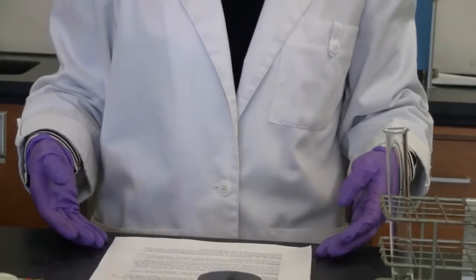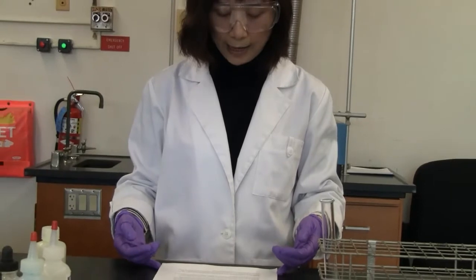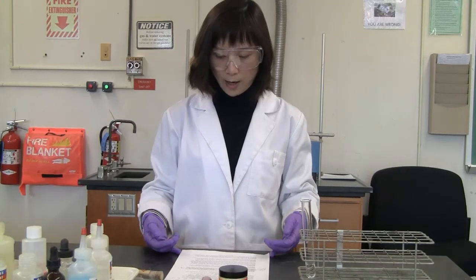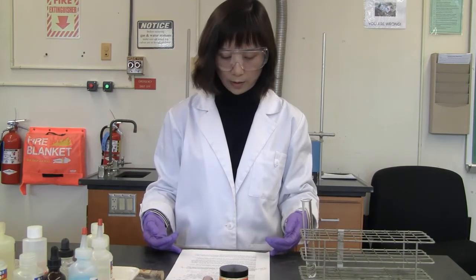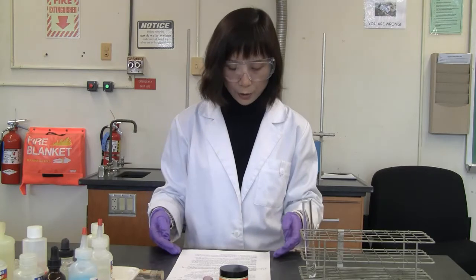For this part, when you write the chemical equation, make sure you don't put the catalyst into the chemical equation. And also, water is the medium dissolving the material in, so water shouldn't be in the equation as well. Now let's move to reaction 2.